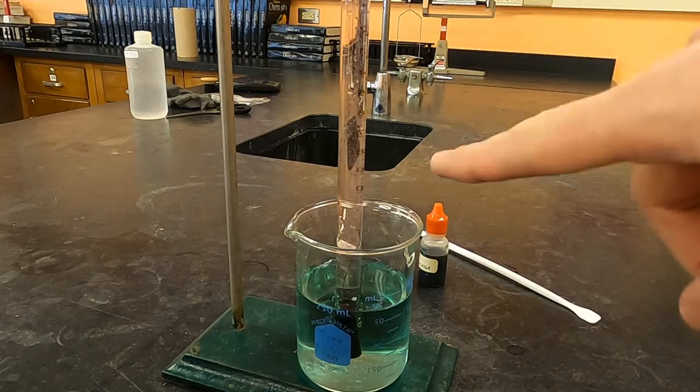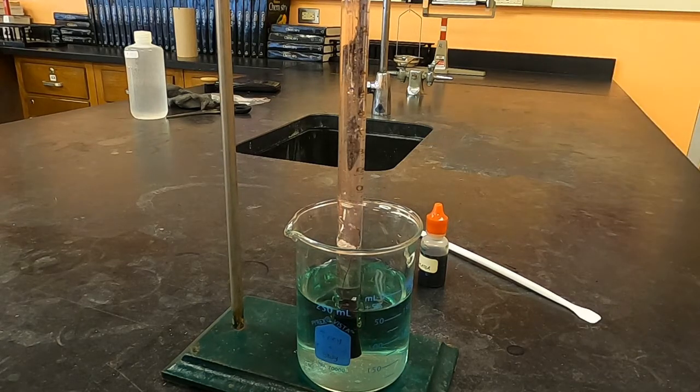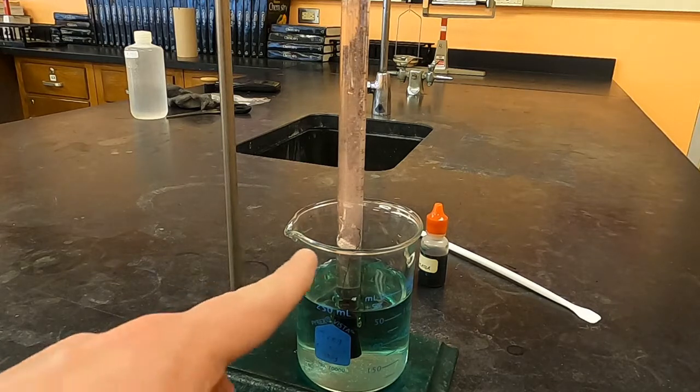See, the red acid is coming down and as the red acid comes down that's how it's dissolving the metal. And when it dissolves the metal it gives bubbles too — it makes bubbles.